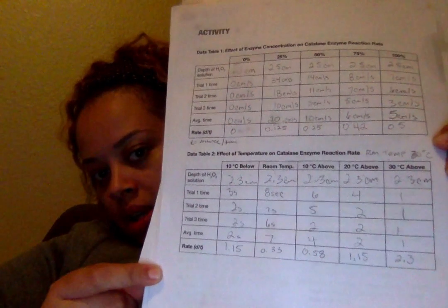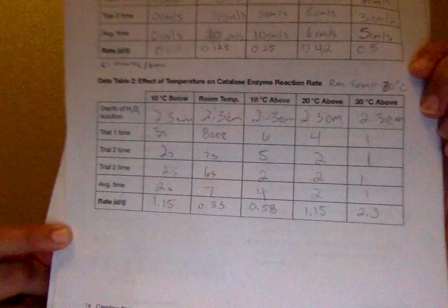For the second activity, the effect of temperature on catalase enzyme reaction rates is the second data table. Based on this experiment, we used the temperature of the catalase and the hydrogen peroxide to determine the reaction rate. It seemed like it fluctuated quite a bit. My room temperature was about 30 degrees Celsius.